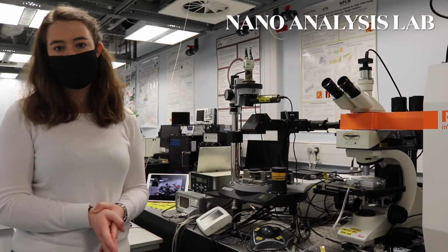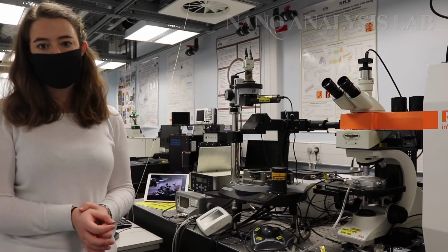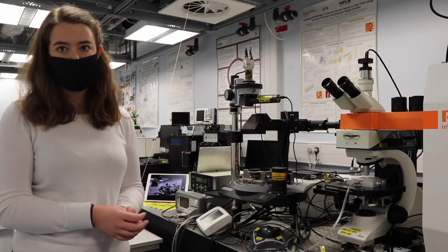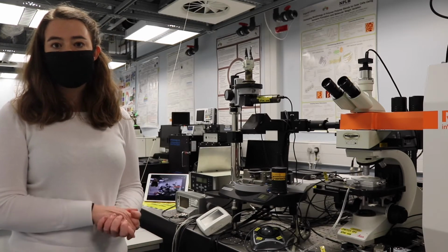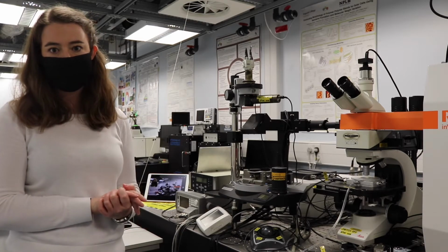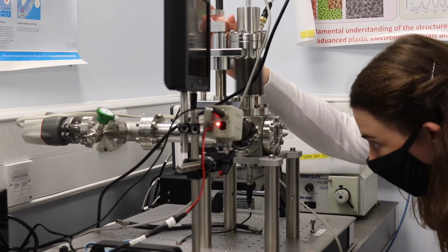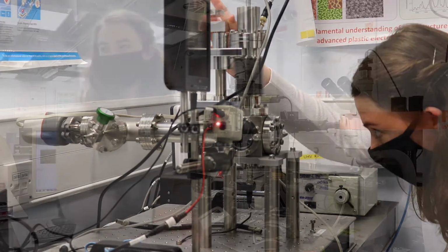Welcome to the Nanoanalysis Lab. Here we specialise in the characterisation and analysis of materials for energy and healthcare applications. In our group we work a lot on solar cells and light sensors, and then we also work with sensors for medical observation and diagnosis.